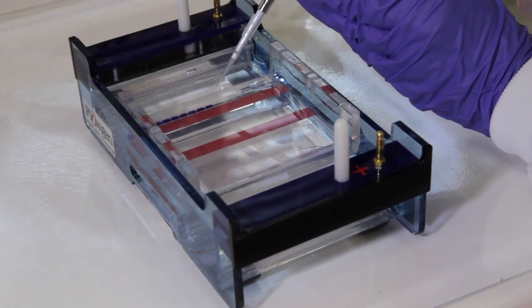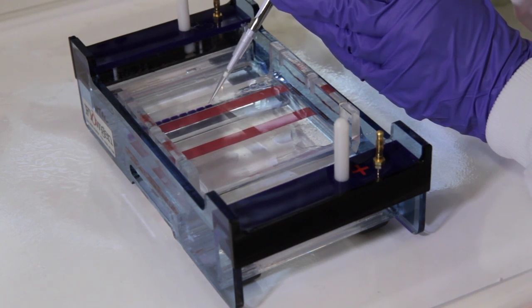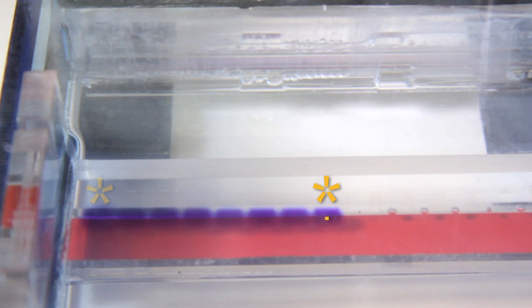Finally, load the next aliquot of your size standard. It's good practice to have a size standard every few lanes in the gel, if you want to accurately size your fragments.